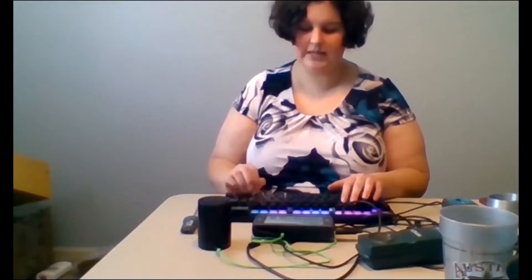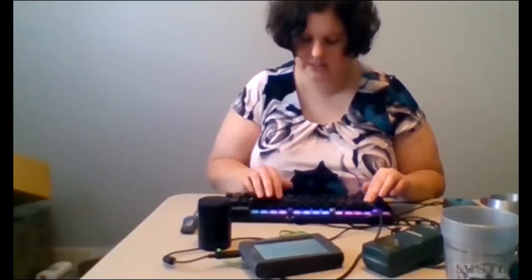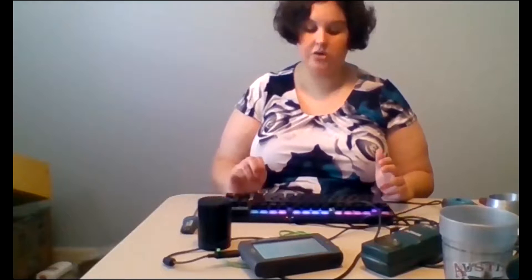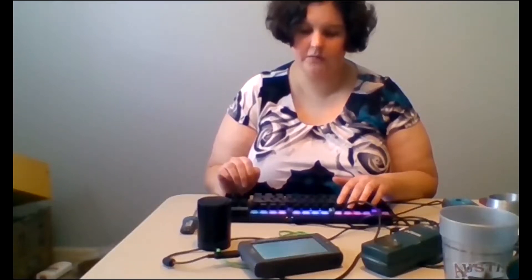Now we're going to look at some of the other features on board. We have a basic scientific calculator. I can use the keyboard to type out two plus two and get four. I can also do sine functions and other scientific calculator functions. The F4 key is a forward/back key that takes me back to the home page or the last page I was on.